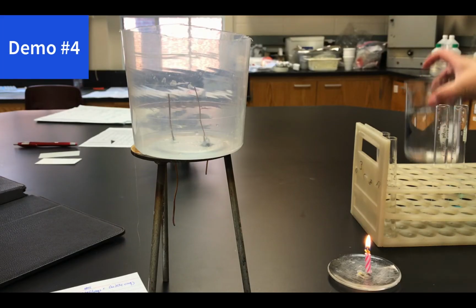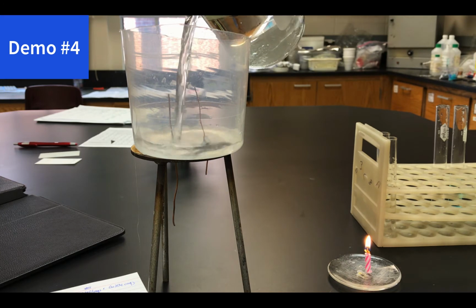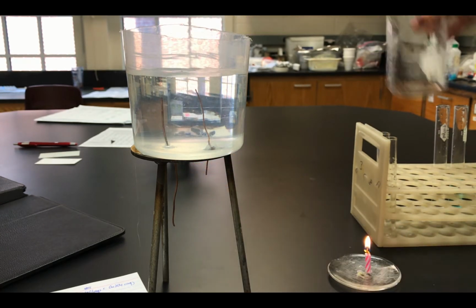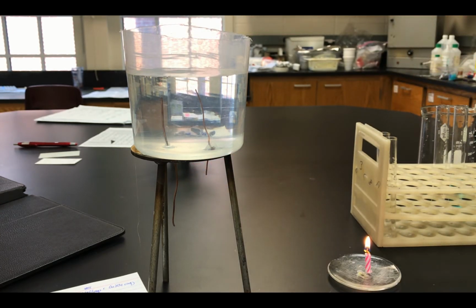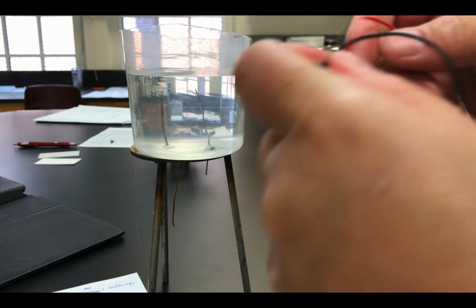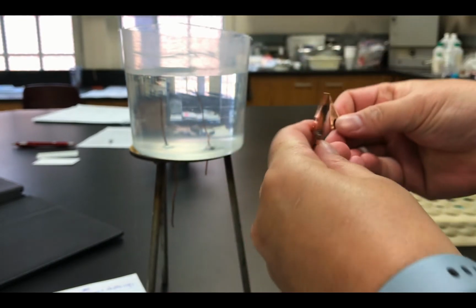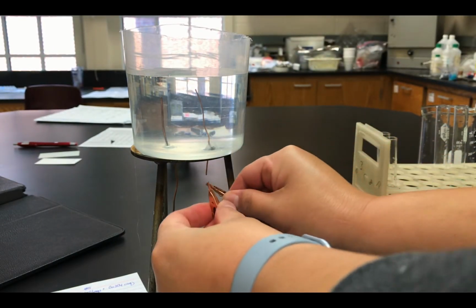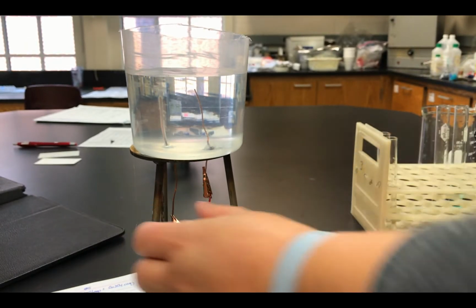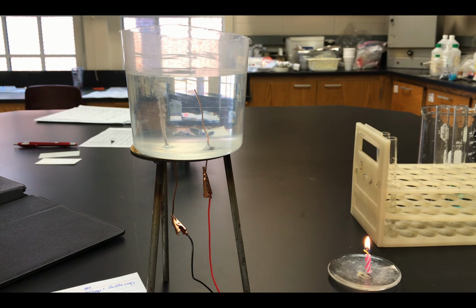Now we have demo number 4. First, we're going to take some water, and it's actually an aqueous solution of sodium sulfate because there need to be some ions present in order for electricity to be conducted. So we add that water to our tub where we have 2 copper electrodes, and here we have a battery that we're going to connect some electrodes to, and we are going to then hook this battery up to those copper wires. Note that once we get that battery hooked up, ta-da! Now you should look at your reaction and ponder. Well, you should just write down your observations first, and then you can ponder the implications of them, right?